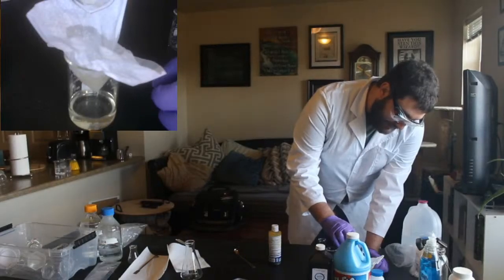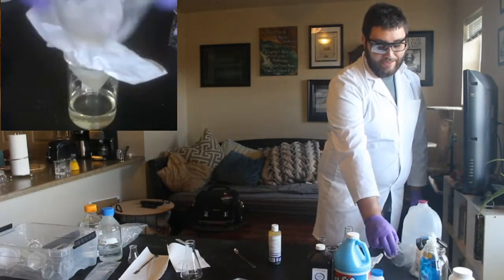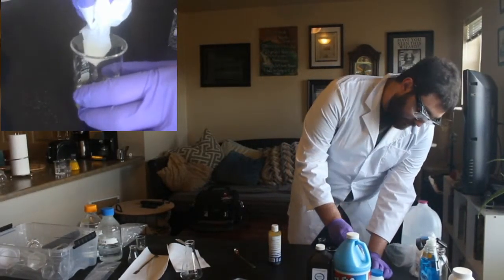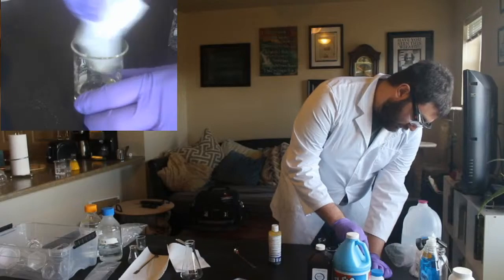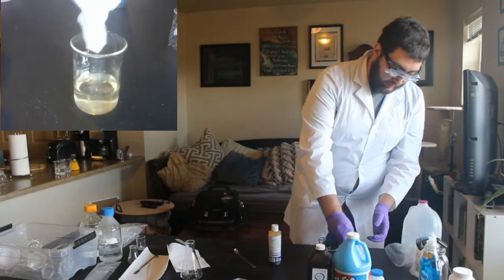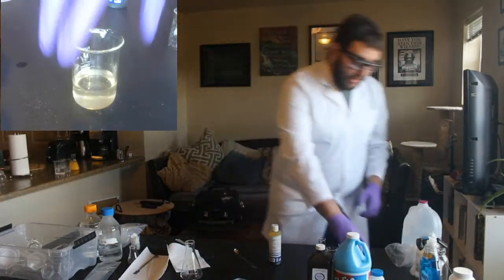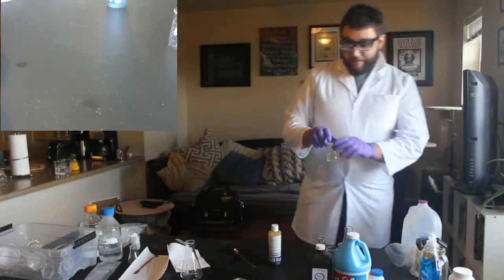And the more stuff it collects, more of those solids. And you can see there's what we have left behind. We can just set that aside. We don't need those solids. And then once we have this, you can see there's still some liquid in here. So now what I'm going to do is I'm just going to go put this wet coffee filter over in that waste because we don't need that anymore. And now you can see it's kind of yellowish, but it's mostly clear. It's not so cloudy anymore. So there's our vitamin C solution.